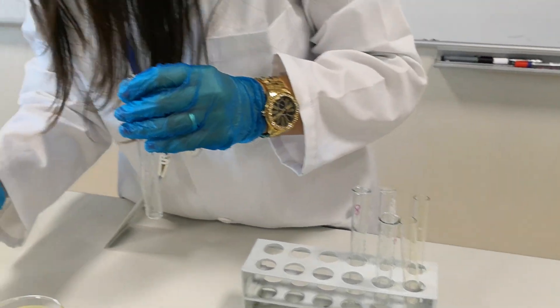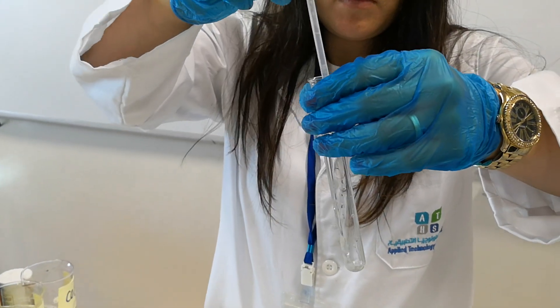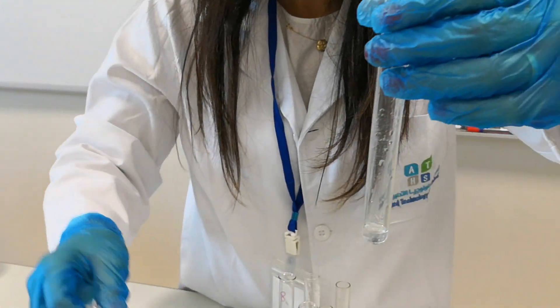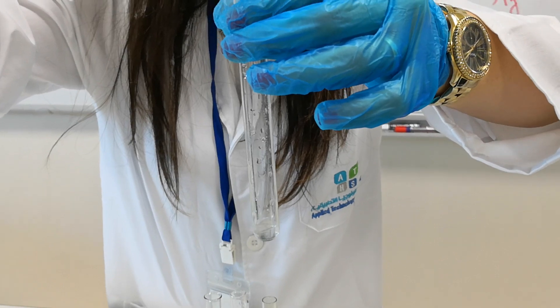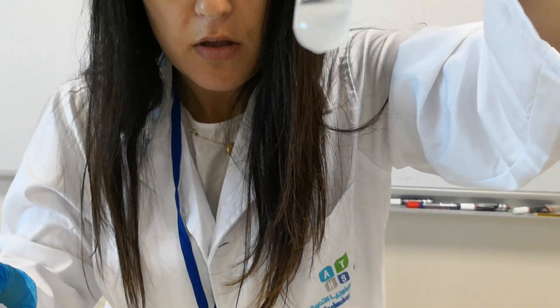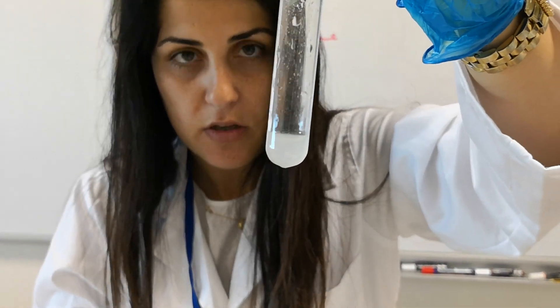Now let's try barium. Adding sodium hydroxide to the barium solution — this is not a precipitate, but the solution turns cloudy.